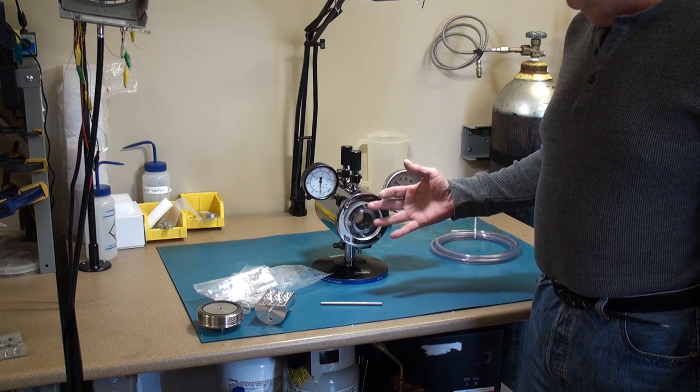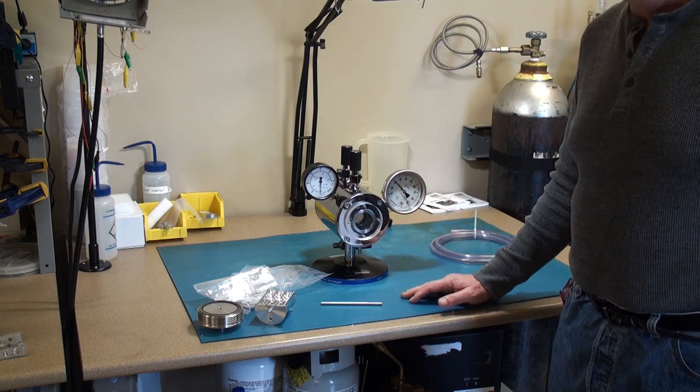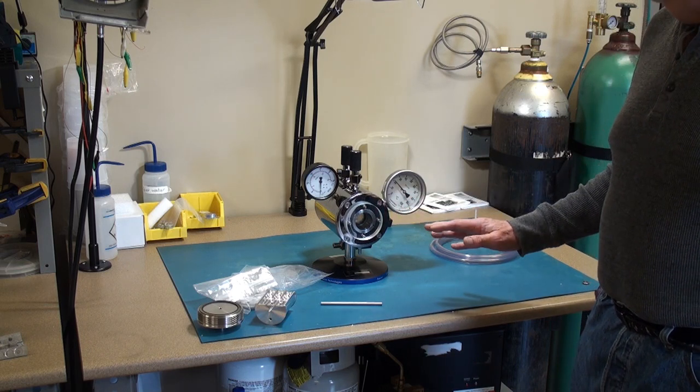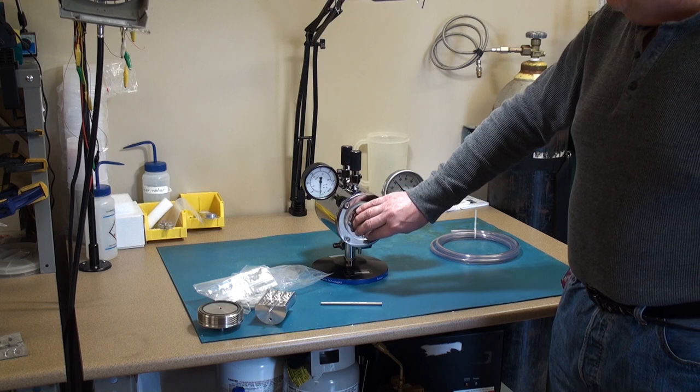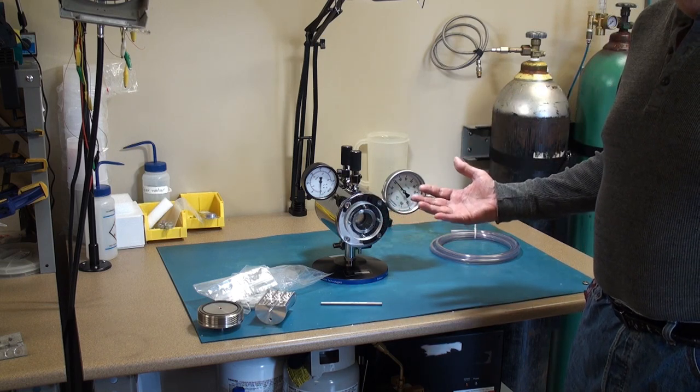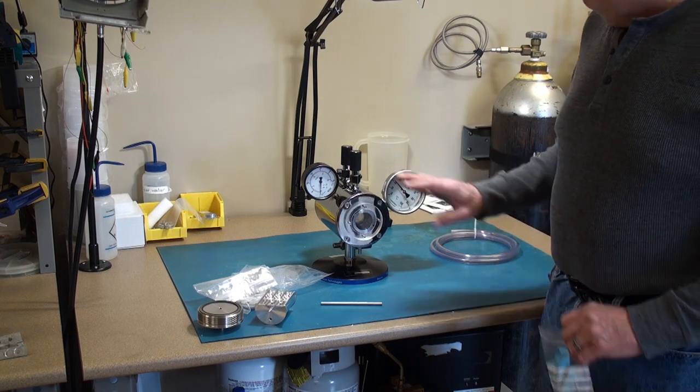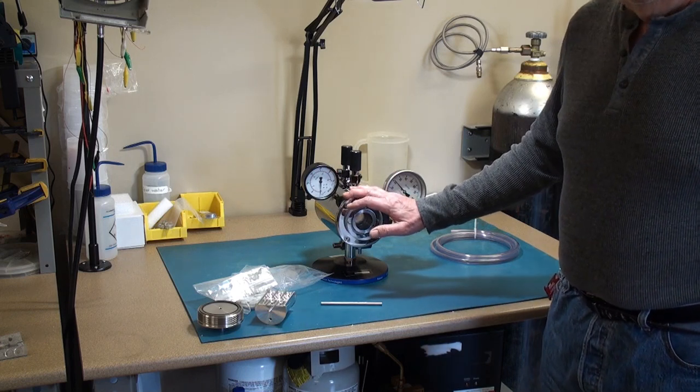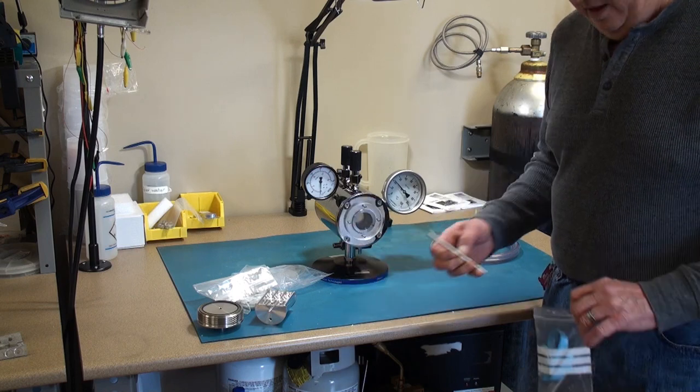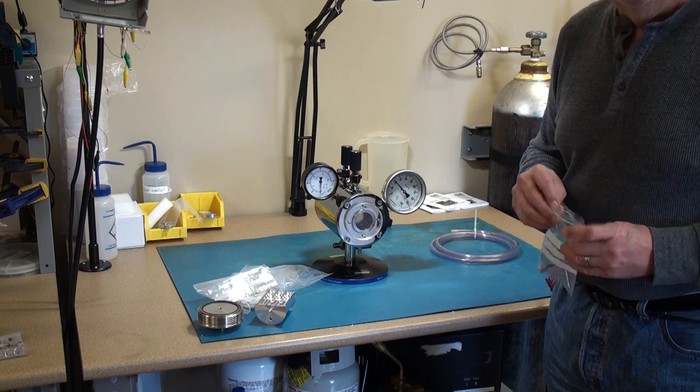So it's possible if misused and the safety systems are bypassed, you know you could result in some injury. So that's why there's protective glass. And that's why I highly recommend you send your instrument in to EMS to be serviced. I've been working with this particular critical point dryer since the mid 80's. I know it fairly well and have serviced it for quite some time also.